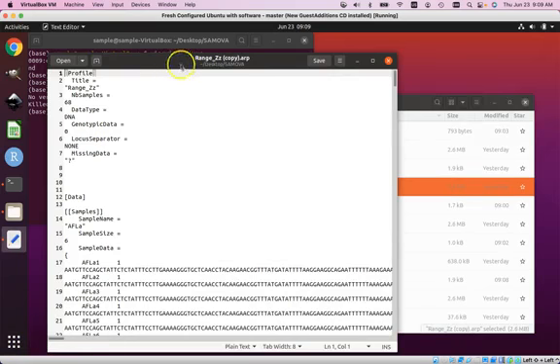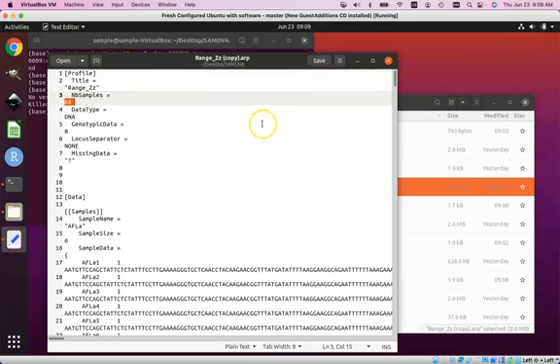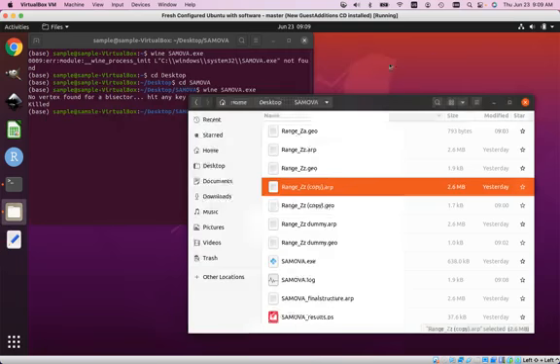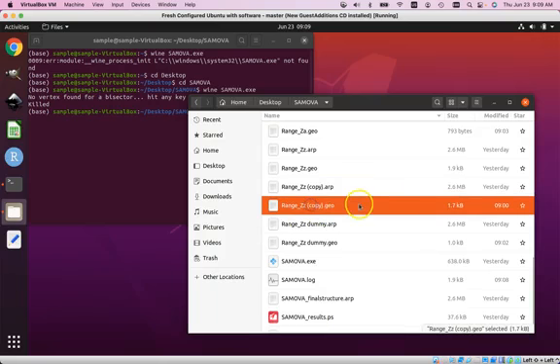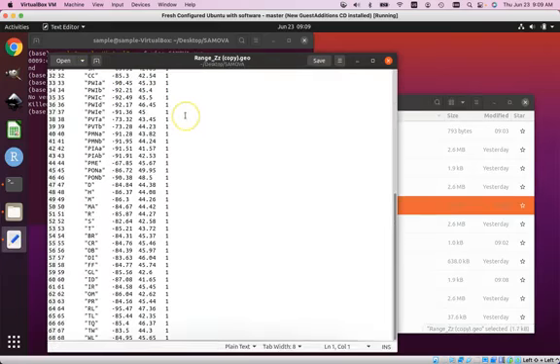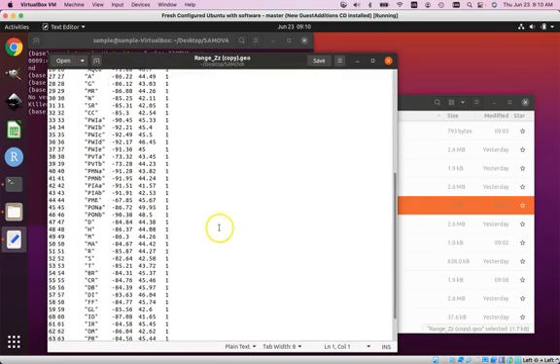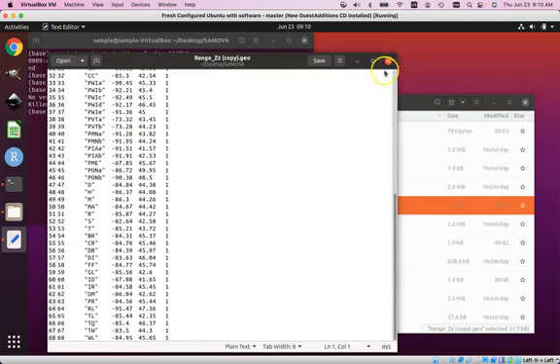Let's take a look at Dan's Arlequin file. He has 68 different individuals in his file for which he has DNA data. Let's take a look at his geo file. And everything looks great. There is his longitude, latitude data. Everything is formatted properly. And there are 68 specimens.